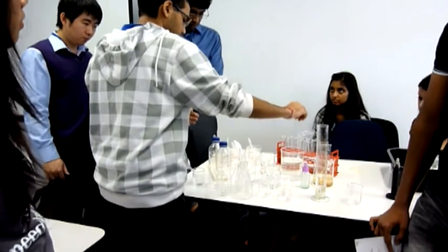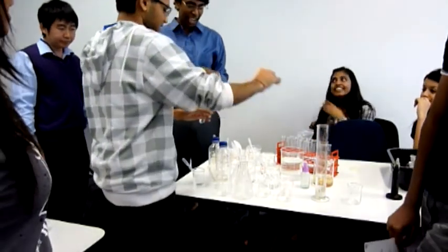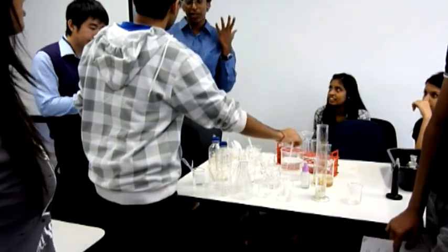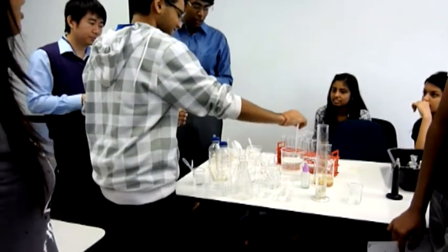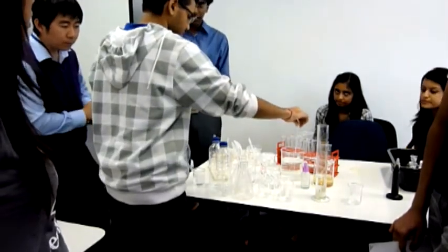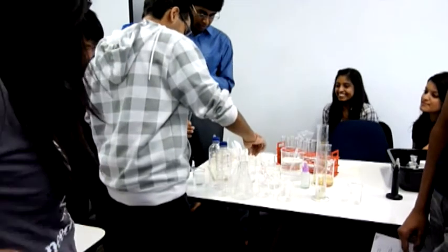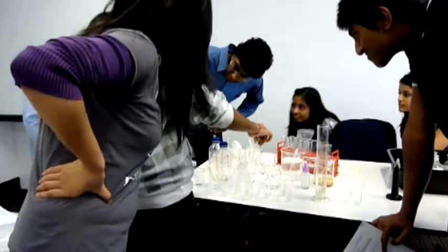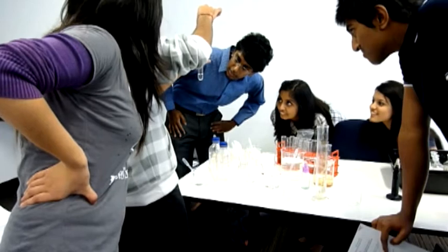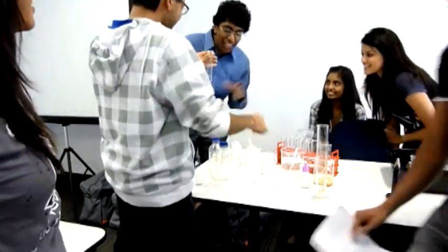What's the molar ratio between the carbon in this reaction? If you wrote it out, what do you get? It's better to go with the ionic reactions. So we get hydrogen ions reacting with carbonate ions to form carbon dioxide. Hold it from here so it's more clear. You can see it's like opening a Coke can. Just to let you know that's 10 molar.